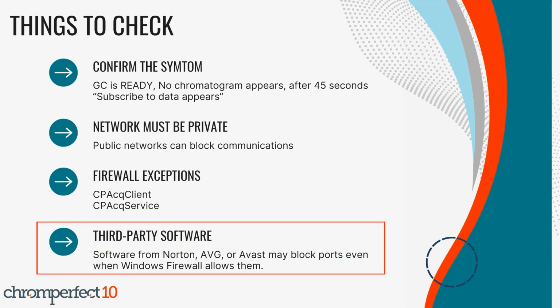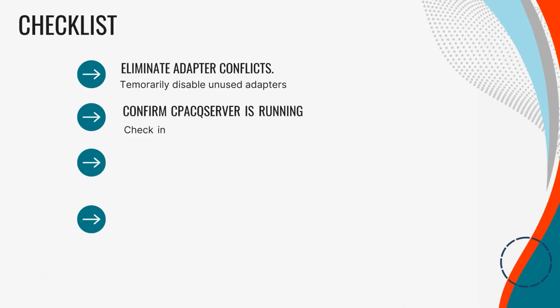Step 4: Check third-party security software. Security suites like Norton, AVG, or Avast may block ports even when Windows Firewall allows them. Temporarily disable the third-party protection and retest for 2 minutes. If the chromatogram appears, re-enable protection and then add exceptions for the 2 programs we discussed previously: Chromperfect Acquisition Client and Chromperfect Acquisition Service. Also, add one for your Chromperfect data port. Your IT team may need to do this.